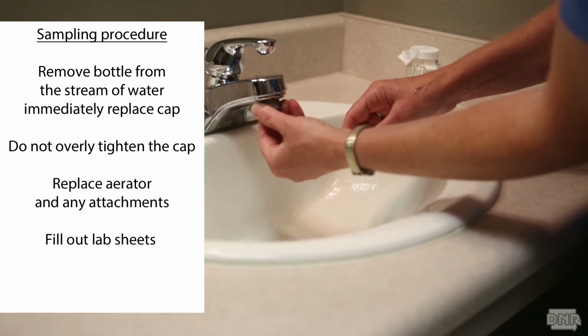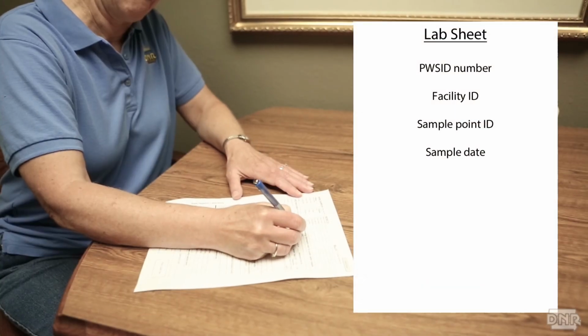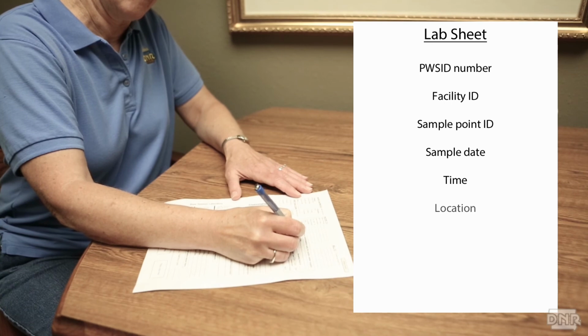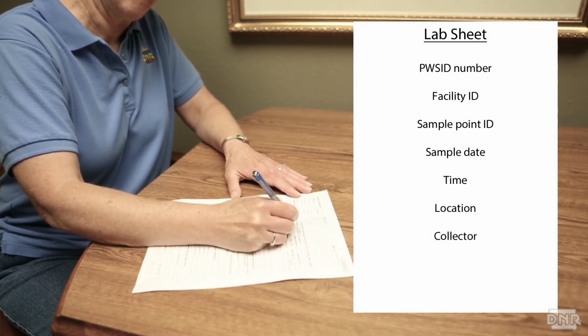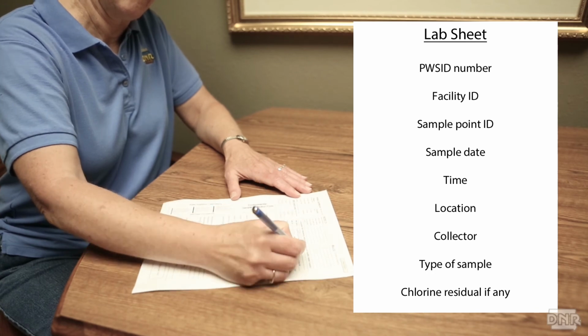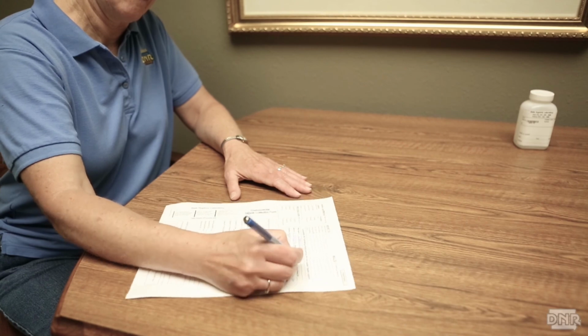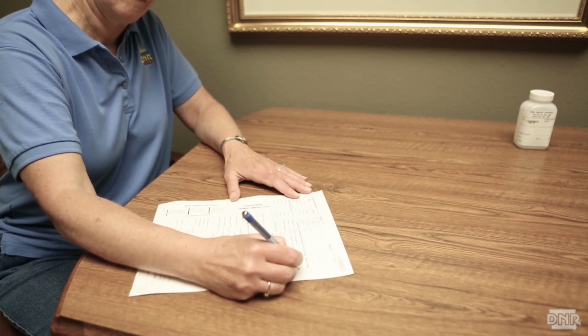Fill out the lab sheet and be sure to include your PWS ID number, sample date, time, the location, the collector, the type of sample, and the chlorine residual if your supply is chlorinated. Make sure you label your samples correctly according to your operation permit and or your sampling plan.